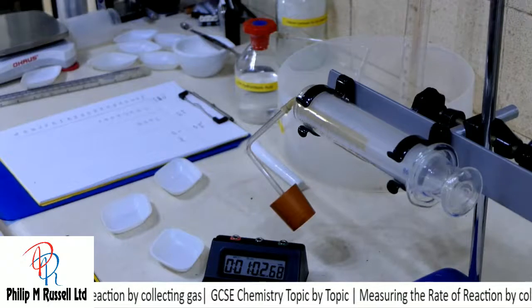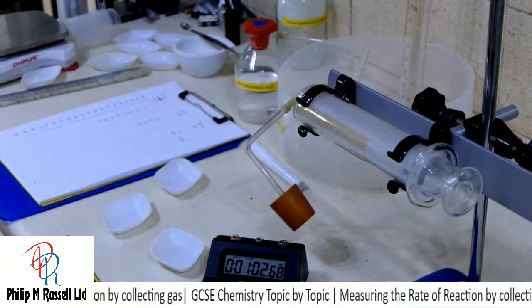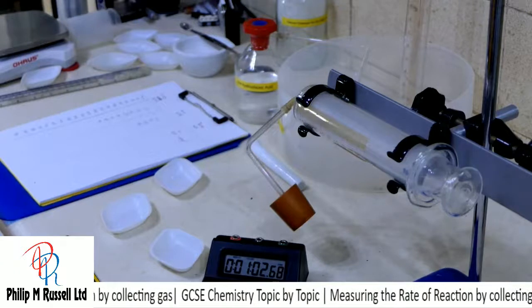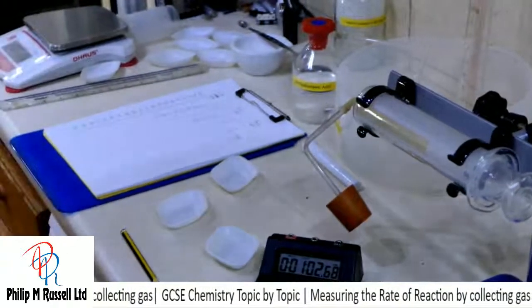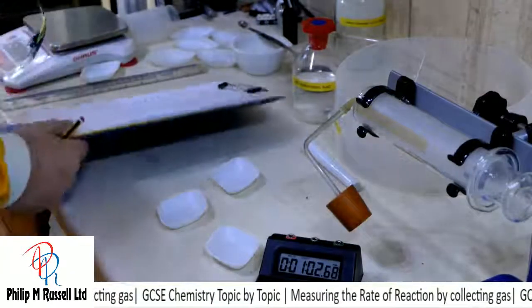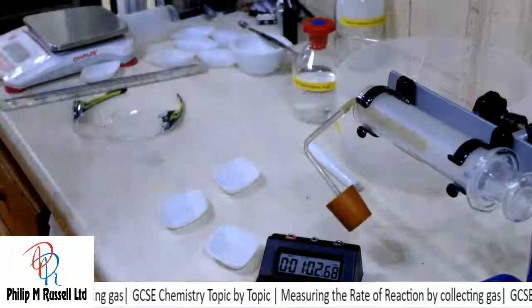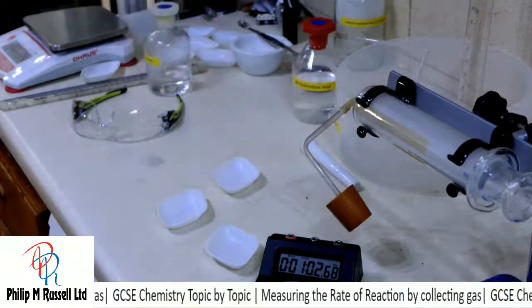So let's have a look at this experiment very quickly and we can see what we've got. So what I'm going to do is let's try and plot the results. So I'll take my safety specs off and we'll go over and plot out the results.